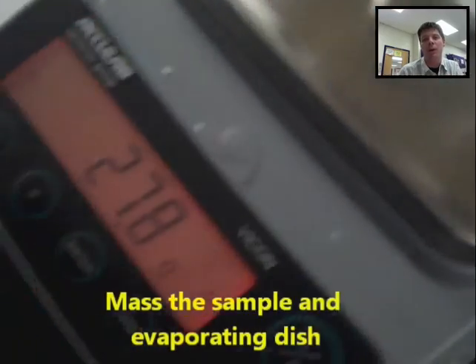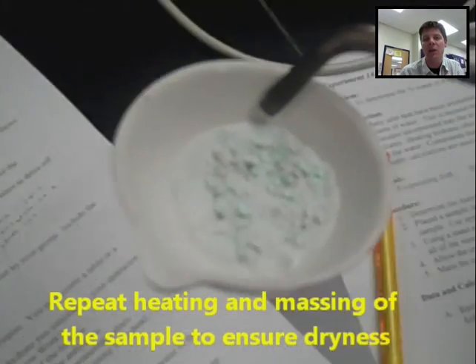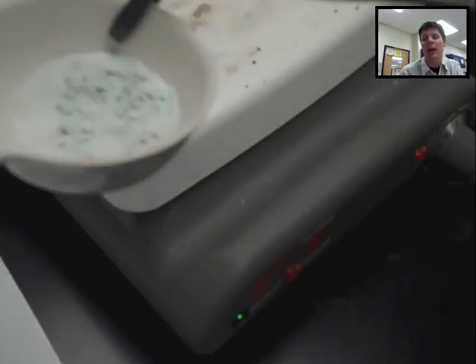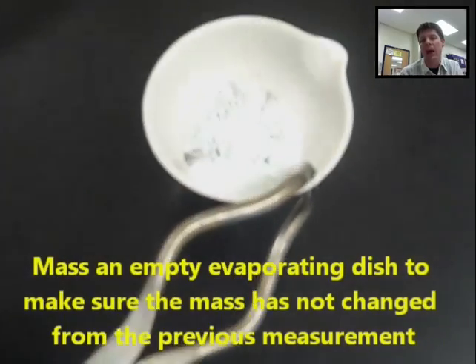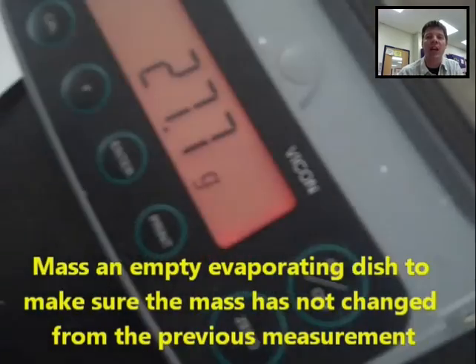We can see that that's happened with the copper sulfate sample here. At the end of the experiment the students are massing this to determine the change in mass, and the change in mass is due to the water that was driven off by the heating of the sample. What we're seeing the students do at this point is just a repeat heating to make sure that the sample is fully dried. Once they've heated it again they'll allow the sample to cool in order to determine the final mass. We're looking for repeat measurements that aren't changing, which would indicate that the sample was fully dried.